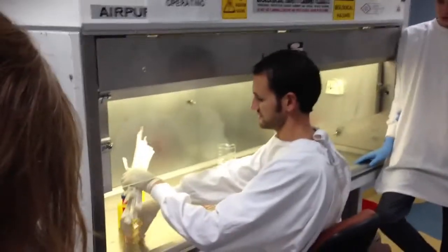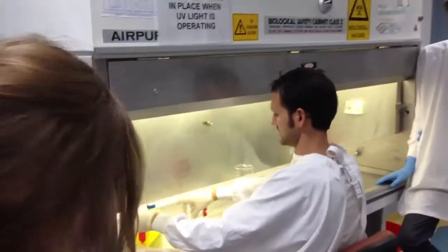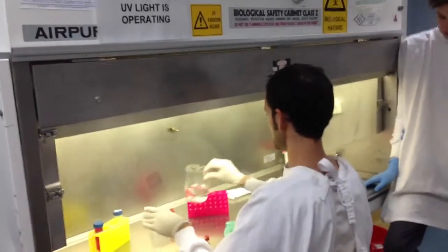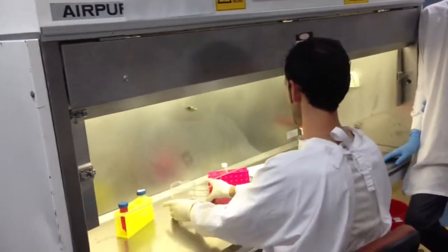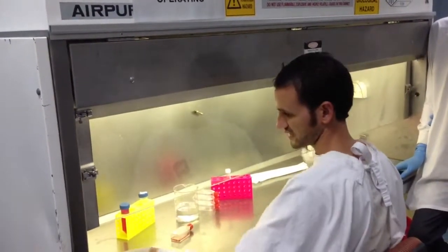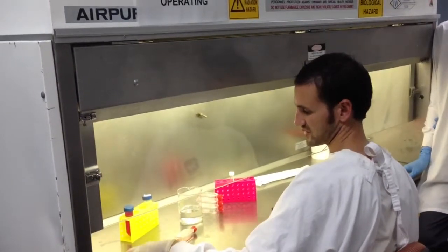We begin by arranging our workspace. What I'm trying to do is separate everything that I might need so I can access it. I'm right-handed, so I'm going to have the pipettes on my left.